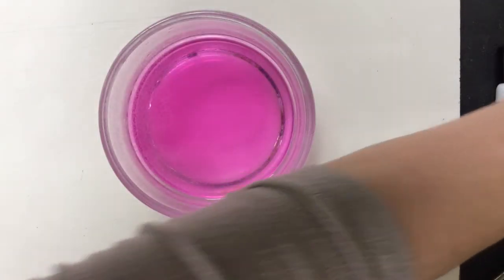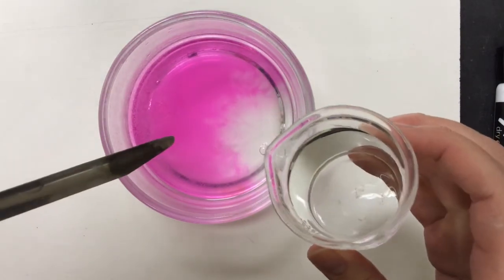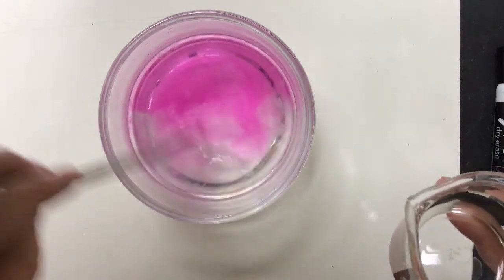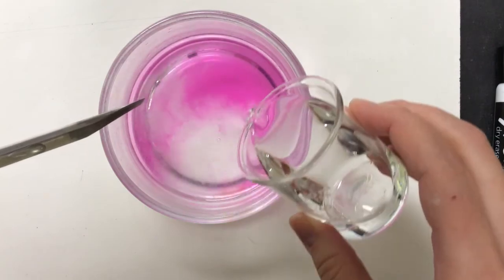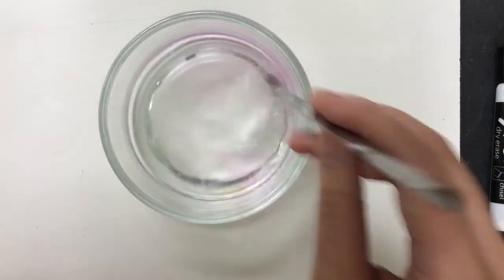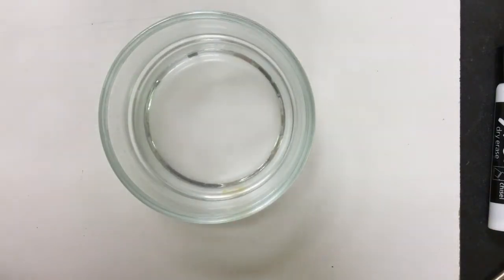In order to carefully dispose of the chemicals that we had in our last reaction, we need to neutralize it. So actually I'm going to show you a neutralization reaction, which is another kind of double replacement reaction. The clear liquid in the beaker is a low concentration of hydrochloric acid. So what we've done essentially is we've mixed hydrochloric acid with sodium hydroxide to neutralize the solution. That solution can now be carefully dumped down the drain.